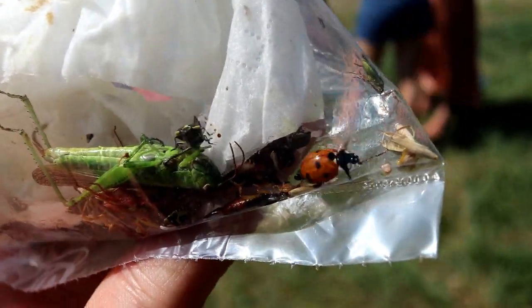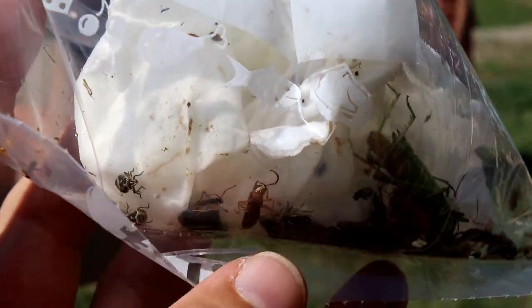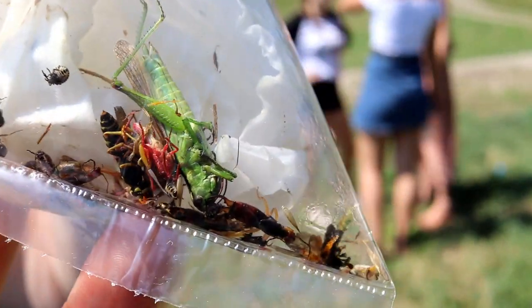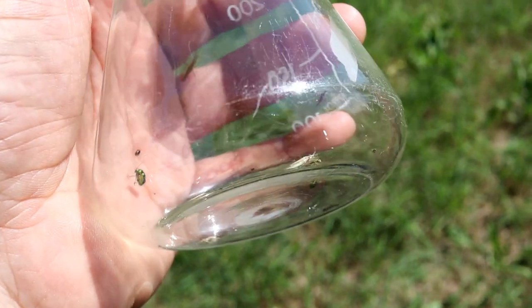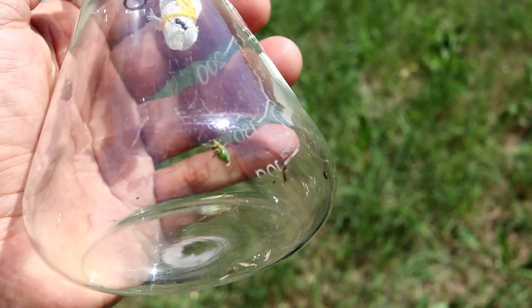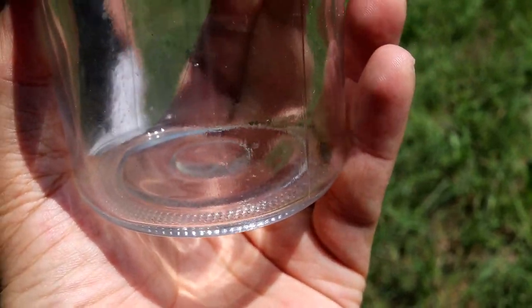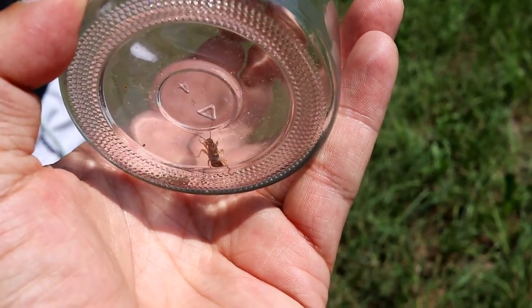We kill the insects by placing a tissue paper with some ethyl acetate into the plastic bag. A few drops of ethyl acetate are enough, and the insects will inhale the fumes and are therefore killed. We had a little ethical discussion about this with the students — some students did not want to do that, which was perfectly fine. But it is absolutely necessary; otherwise it's not possible to observe the insects under the microscope, so it's important not to take too many.